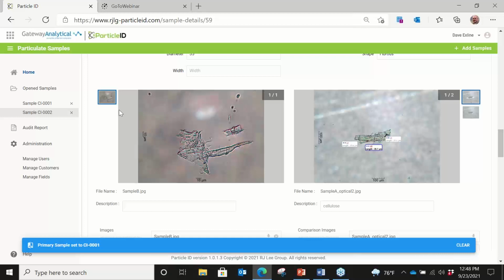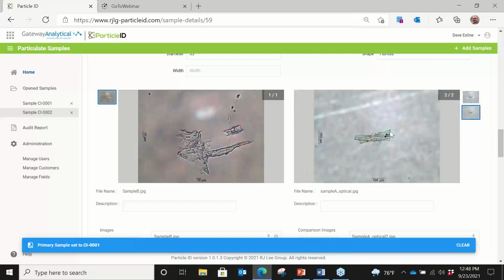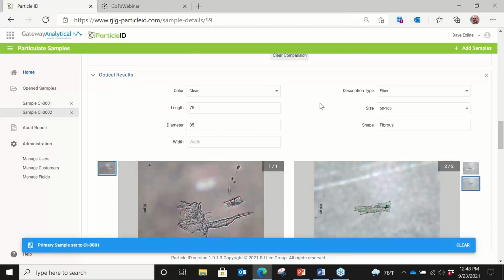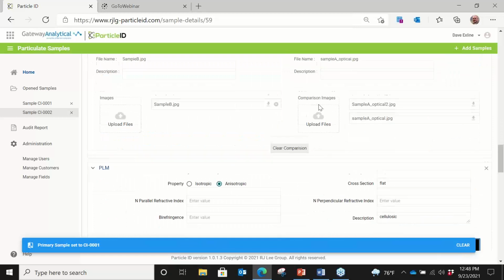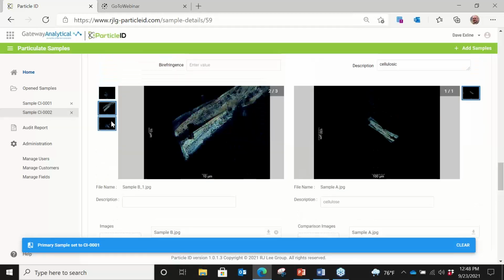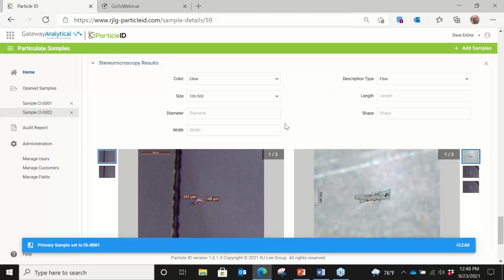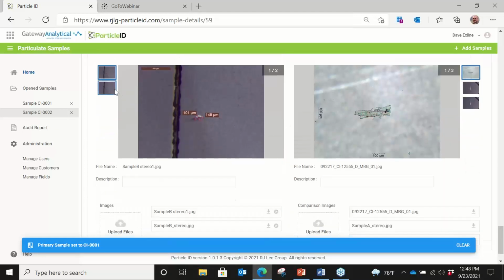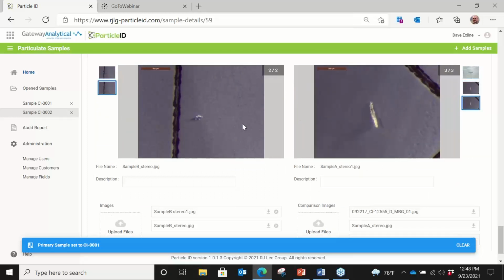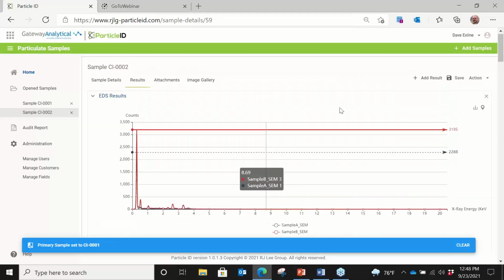So it's a very functional comparison tool that allows us to compare data in a side-by-side fashion. Here's an example of a particle on the left compared to a particle on the right, are both clear cellulose-based fibers. And again, we have polarized light microscopy where we can add multiple images for comparison in a side-by-side fashion. And again, the SEM and stereo microscopy images to do the same from a comparison standpoint. So this gives us a lot of functionality to be able to do that.